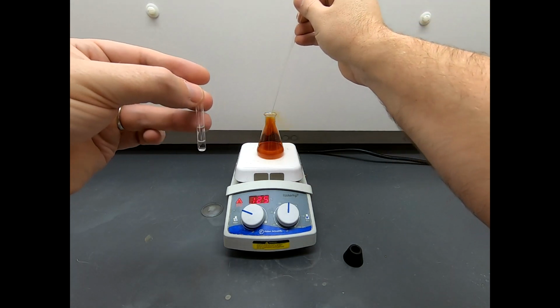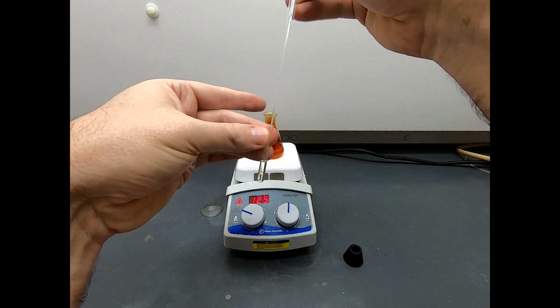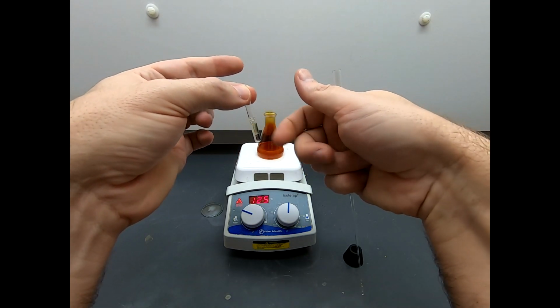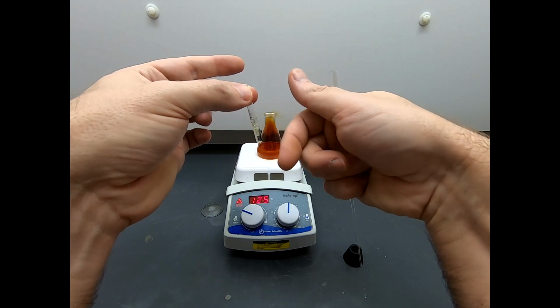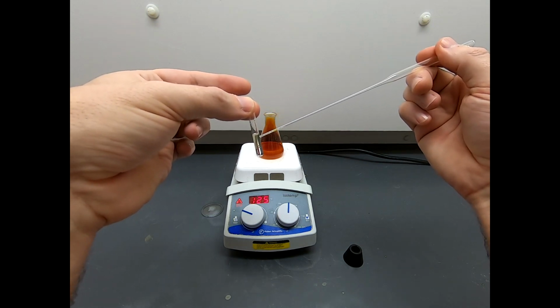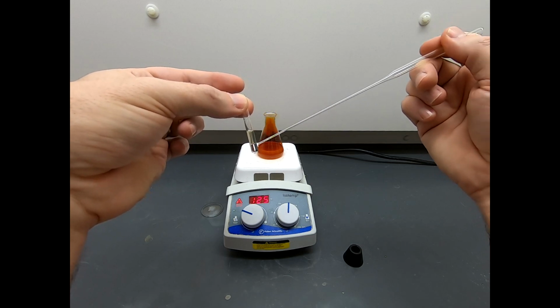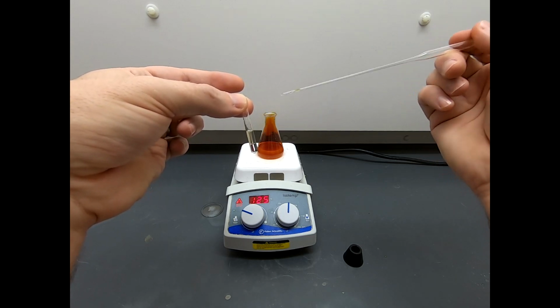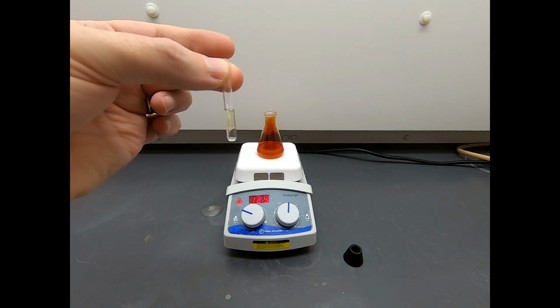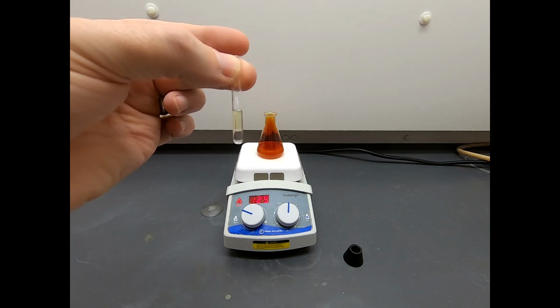So I'm just going to touch this to the surface. You can see there's definitely some junk in there. Let's tap that in. Let the ethyl acetate mix around. And now I'm going to swirl this around a little bit, give a chance for the acid to go in the aqueous layer, and let the organics stay up top. As you can see, there's some yellow color, so it looks like we have some organics in the ethyl acetate layer. That's what we're going to spot on the TLC plate, and hopefully most of our acid has gone to the bottom so it doesn't affect the performance of the TLC plate. So let's go run this TLC. I'm going to run this in 20% ethyl acetate, 80% hexane, and we'll see what kind of spots we get.